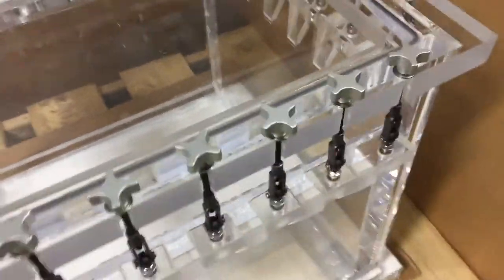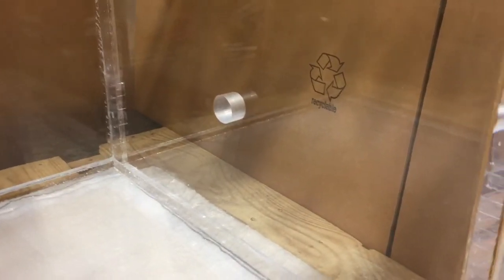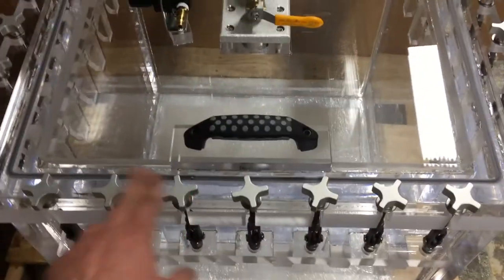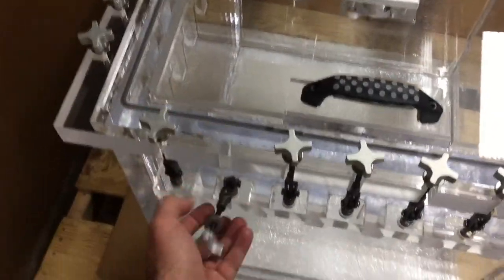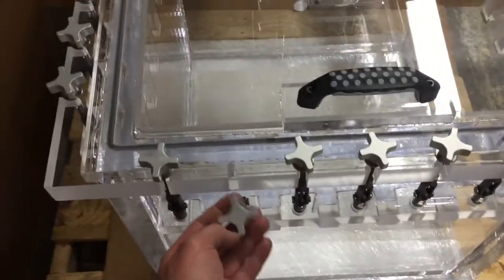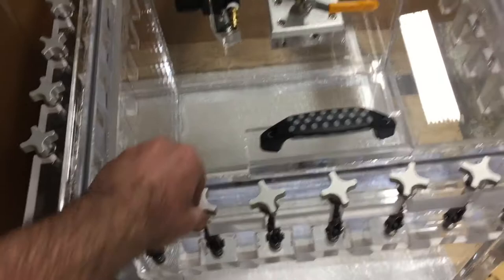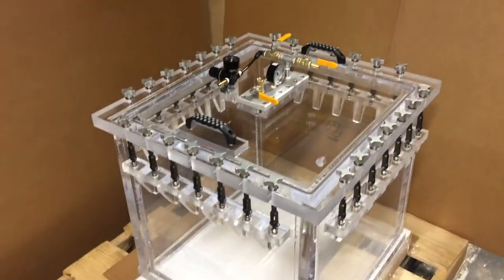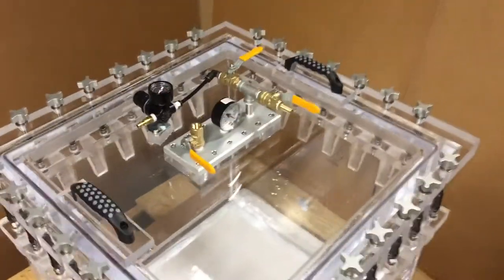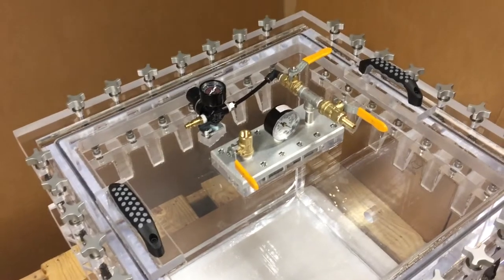Also keep in mind that you have your 30 millimeter hole that you requested — this is on that wall over there. When you are pulling vacuum you will not need these clamps, so you can actually leave all 28 clamps open. But for demonstration purposes I figured I'd start with the clamps on.